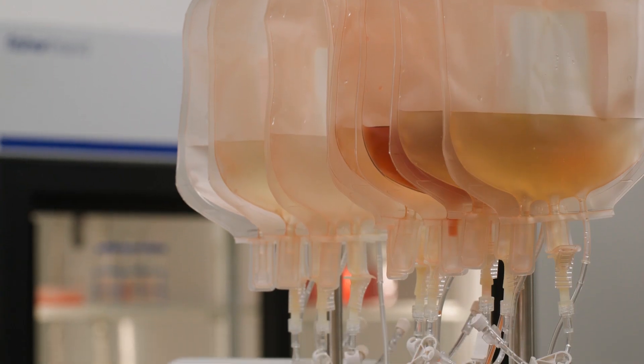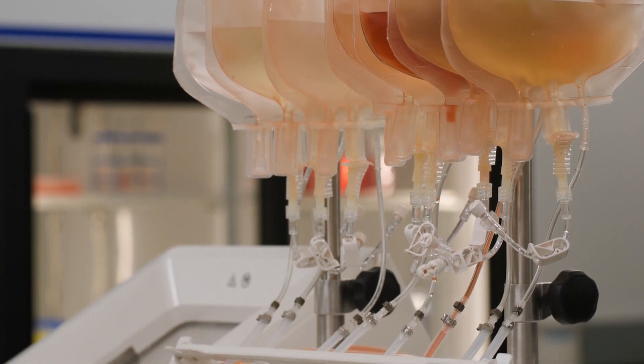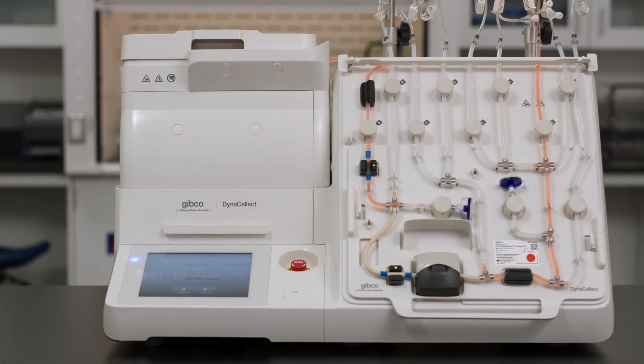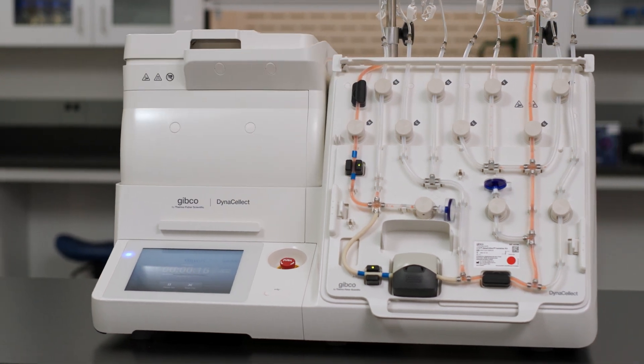Bead removal is achieved through a continuous flow over the magnet, to ensure rapid processing of volumes suitable for autologous and allogeneic workflows.